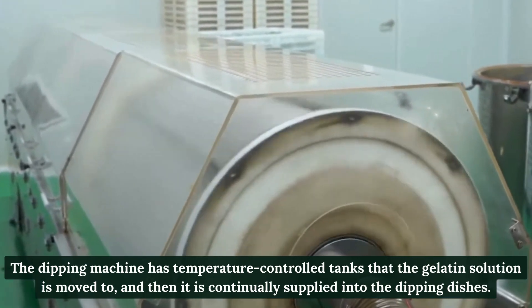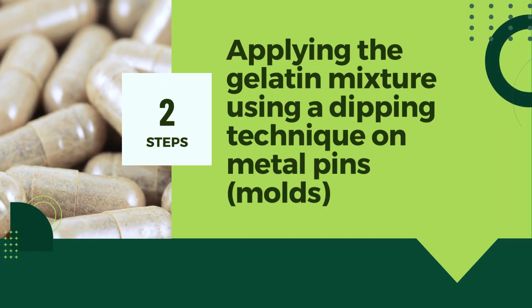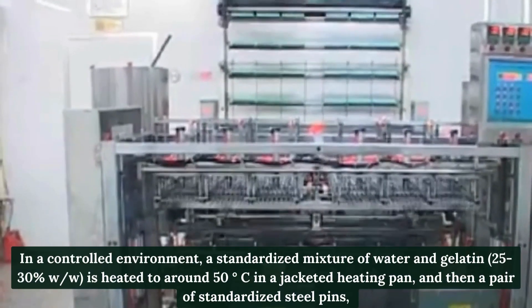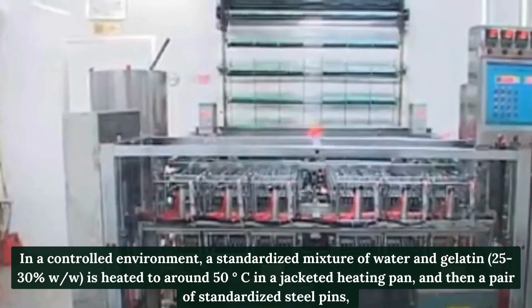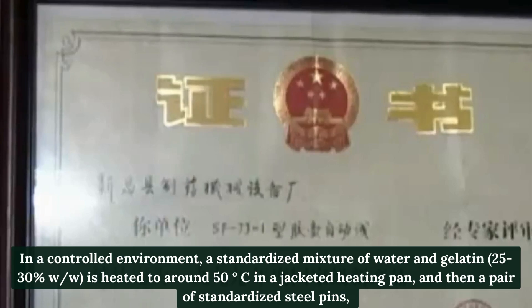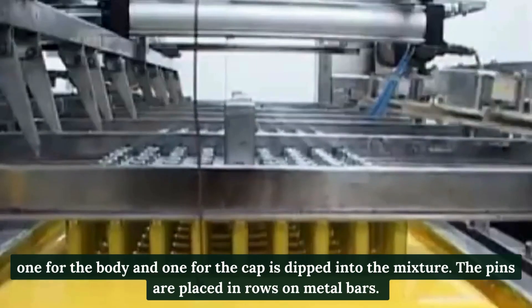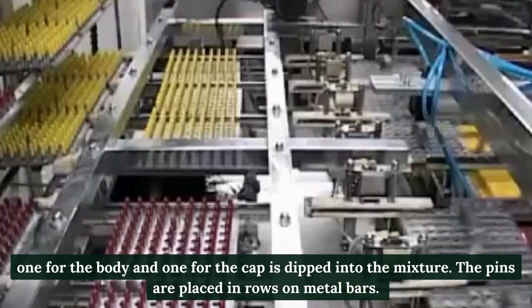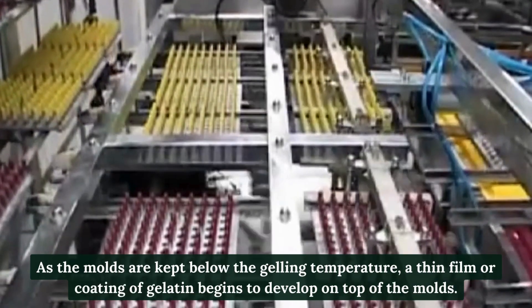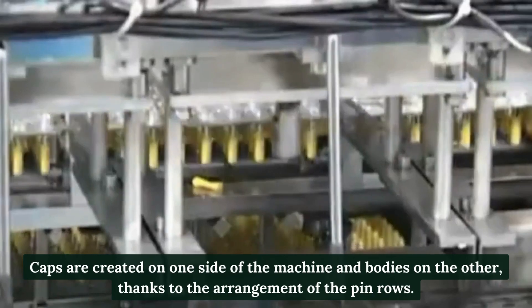Step 2: Applying the gelatin mixture using a dipping technique on metal pin molds. In a controlled environment, a standardized mixture of water and gelatin (25–30% w/w) is heated to around 50°C in a jacketed heating pan. A pair of standardized steel pins — one for the body and one for the cap — is dipped into the mixture. The pins, arranged in rows on metal bars, are kept below the gelling temperature, and a thin film of gelatin begins to develop on the molds. Caps are created on one side of the machine and bodies on the other.